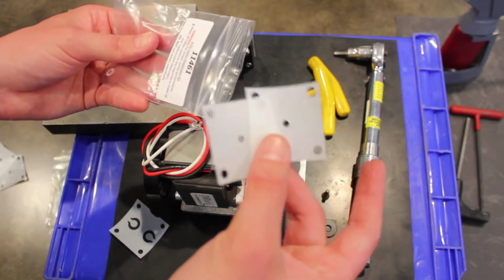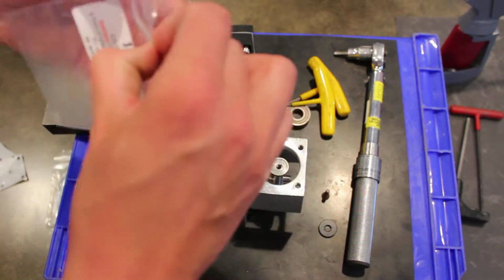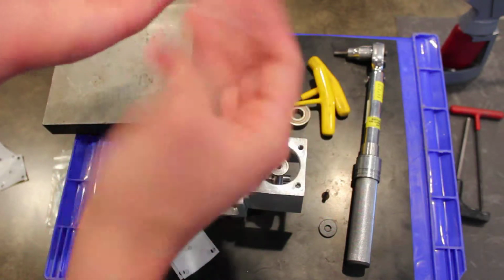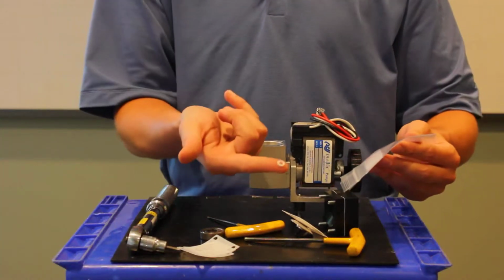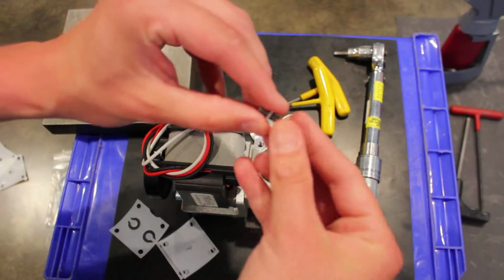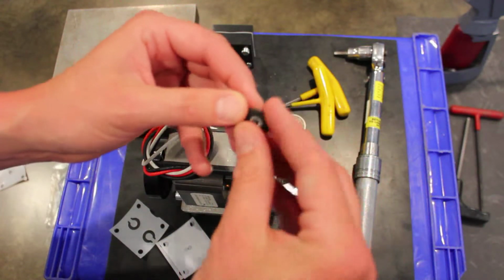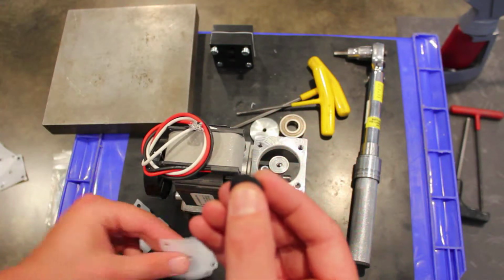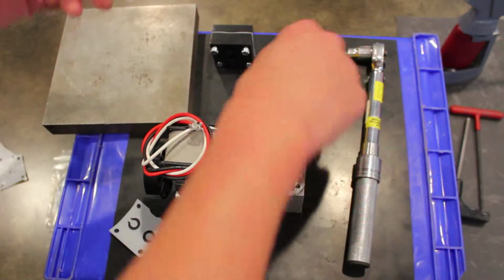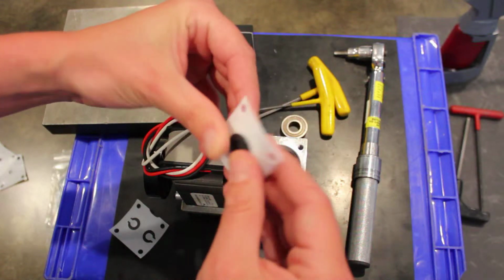Very important, the 2-ply diaphragm is one diaphragm. If it's only used as 1 ply, it's not going to get the pressure and flow required. And lastly, real careful not to lose this, this is a small Teflon washer seal. Grab the diaphragm screw, and we'll go ahead and put it right through the eye of the washer, and then through the eye of the diaphragm plate. And then we'll grab our 2 plies, put it right through the center hole. And then lastly, we'll grab our connecting rod cap and slide that right on the back side.